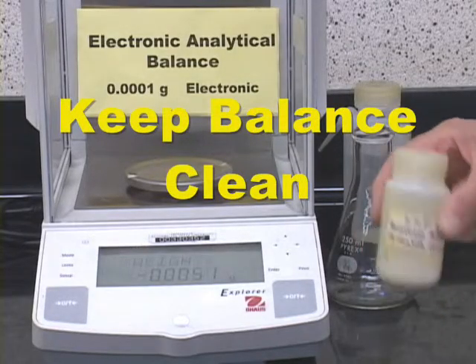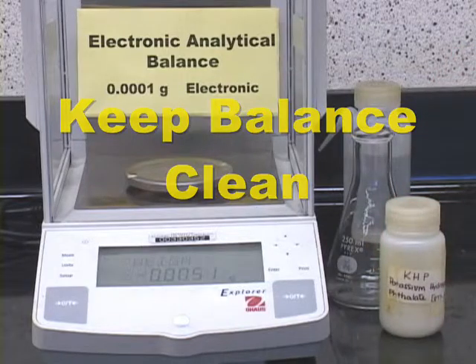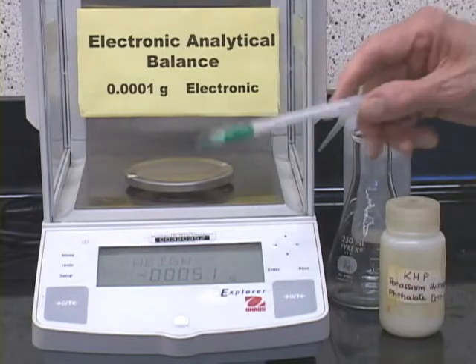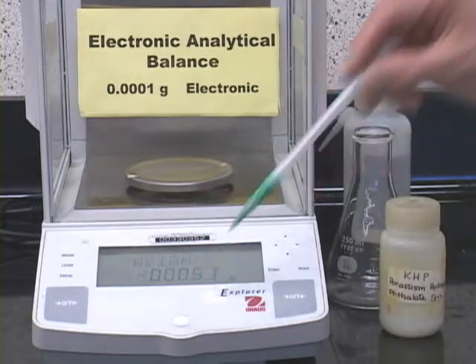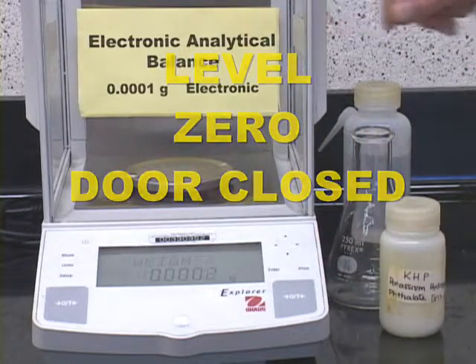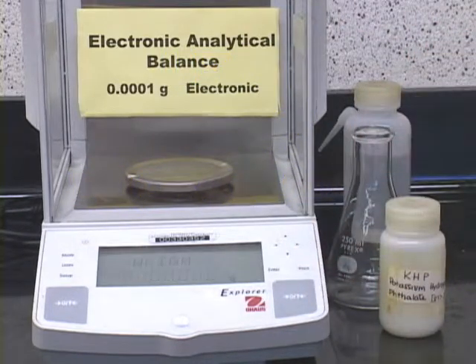That's the KHP, and to do that we'll use an electronic analytical balance. This is an ideal balance to use because the weighing error with proper technique should be less than 0.1%. Now make sure that the balance is level. Make sure that it reads 0 with all the doors closed here, and then you can weigh the empty flask.